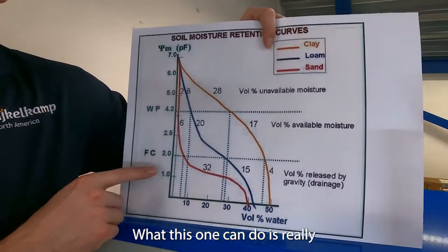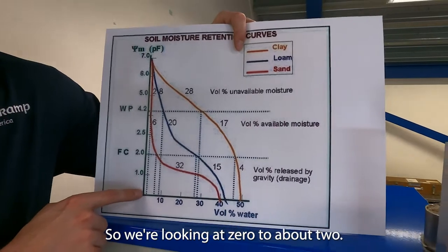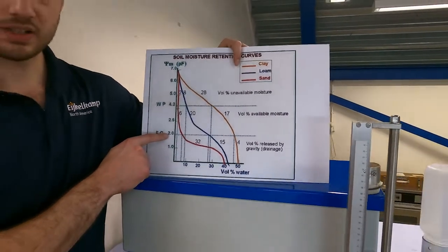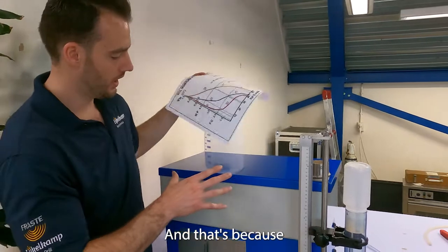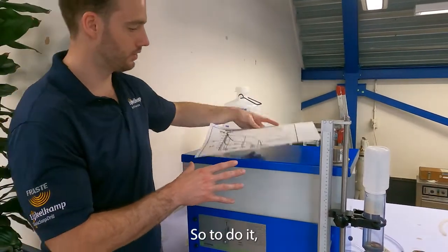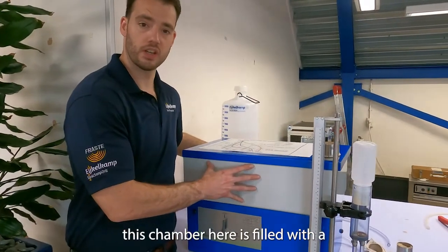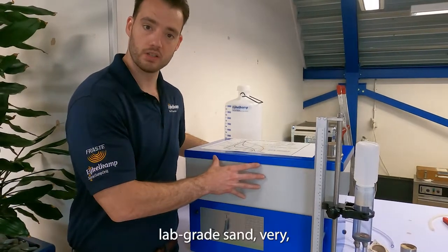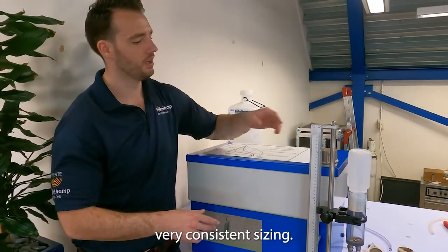What this one can do is really look at the lower range — zero to about two. That's the max that this piece of equipment can do, and that's because this is the sandbox set. This chamber here is filled with a lab-grade sand, very, very consistent sizing.